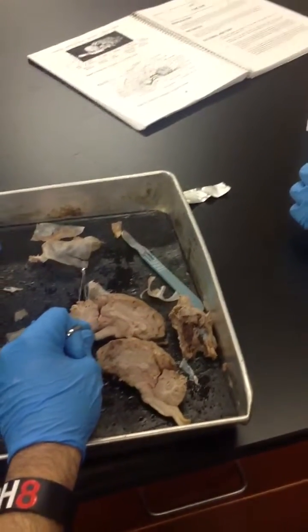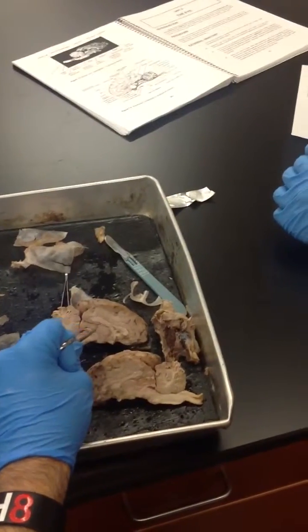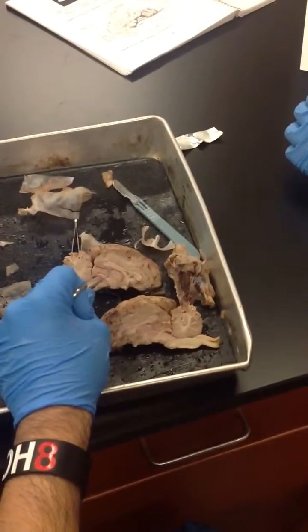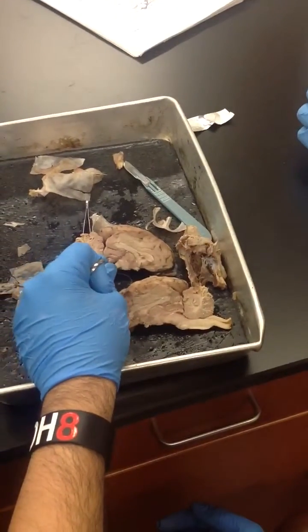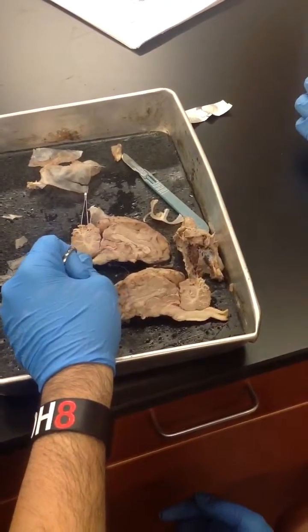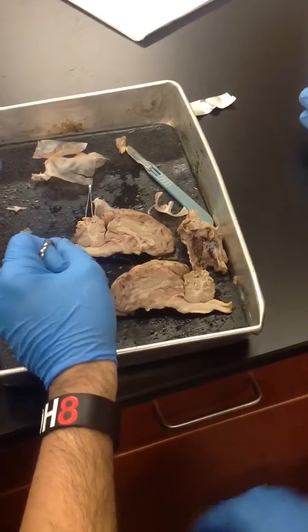Then you have the thalamus in the middle with the third ventricle around it. And then it's connected to the fourth ventricle, which is underneath the cerebellum, through the cerebral aqueduct. Where is the third ventricle? Third ventricle is around the thalamus. Fourth ventricle is right under the cerebellum. And they're connected through the cerebral aqueduct, which is the space that connects the third to the fourth.